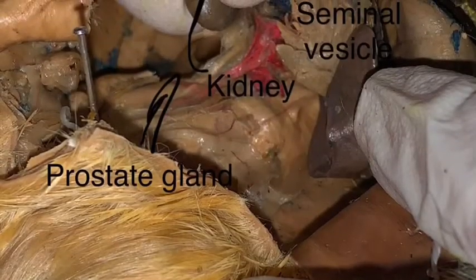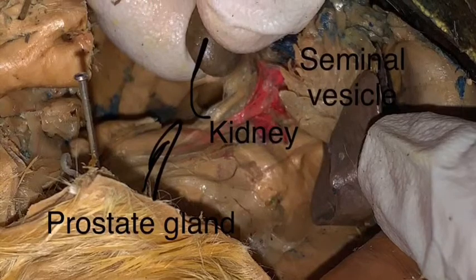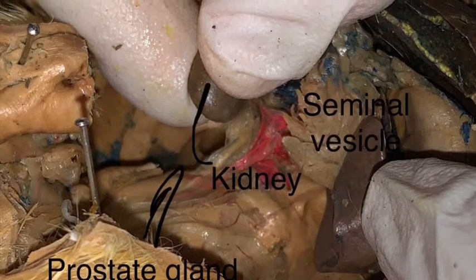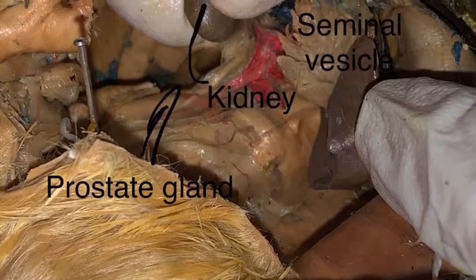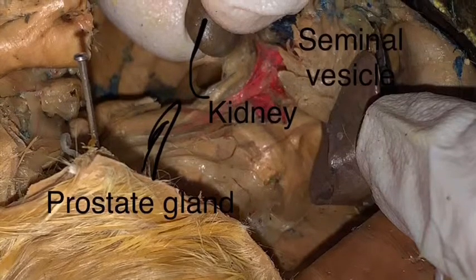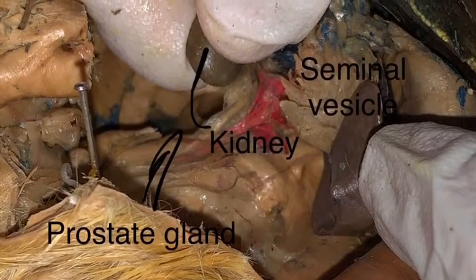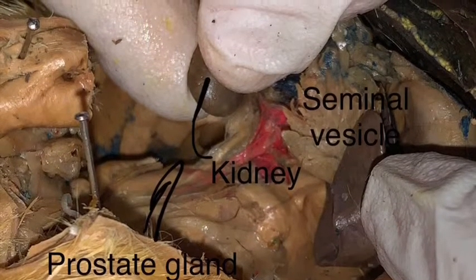This is the urogenital system. This means that it encompasses both the reproductive and the urinary tract, both together. The first 3 organs we see are the prostate gland, kidney, and seminal vesicle. The prostate gland and seminal vesicles are primarily used for secreting semen. The kidney is mainly used in regulating blood.